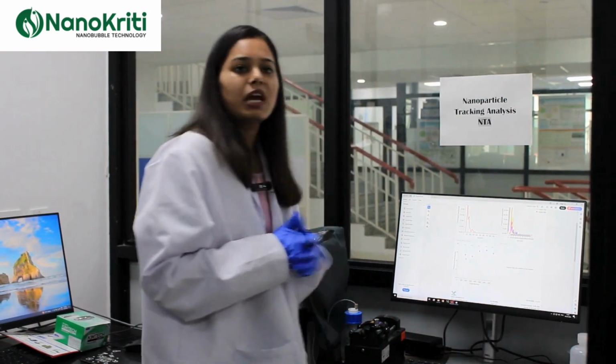So characterization of nanobubbles is highly important for us since we are working on the stability and we are working on different applications as well. So in my case, I'm using CO2 nanobubbles and air nanobubbles for electrochemical analysis of hydrogen production and CO2 utilization. So for me, it means that I need to characterize it for stability and to measure their size and concentration in the samples. That's it.